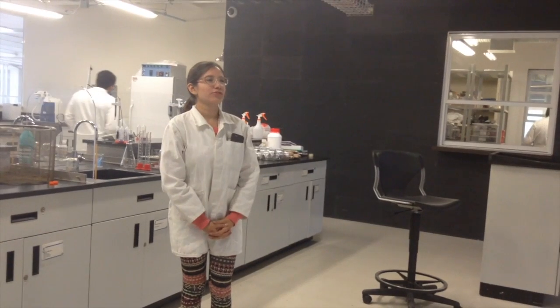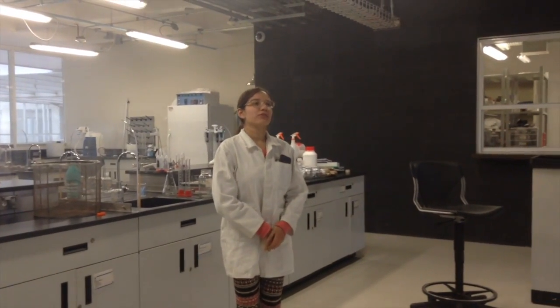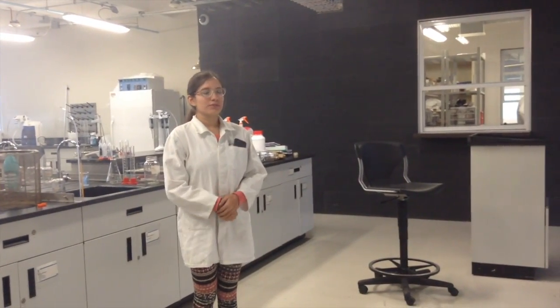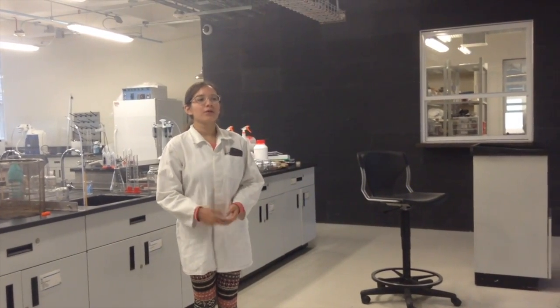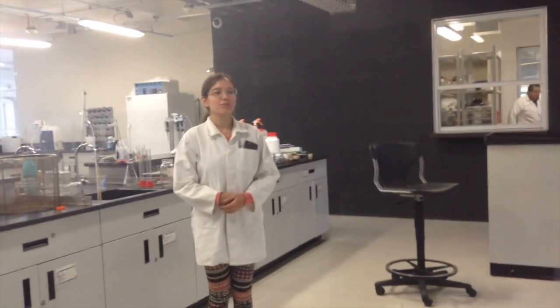While preparing solutions, we consider the use of the correct scale to weigh, analytical in this case, pour the solutions in a suitable container to stock, and work with acids in the extraction booth. We do not add water to the acid. We used gloves with dangerous substances such as acids. While weighing SDS, we took care of not letting the powder fly. We used the vortex to dissolve glycerol in water because it is very viscous. To prepare a TBE buffer solution, it needs to be heated to dissolve, as well as the EDTA component.